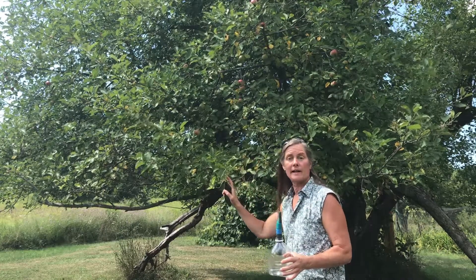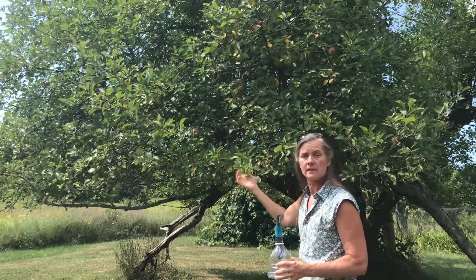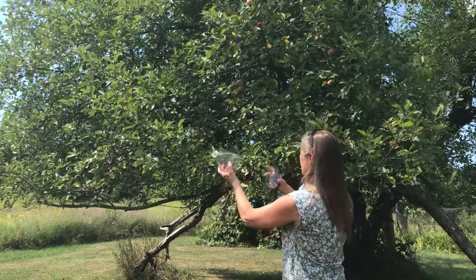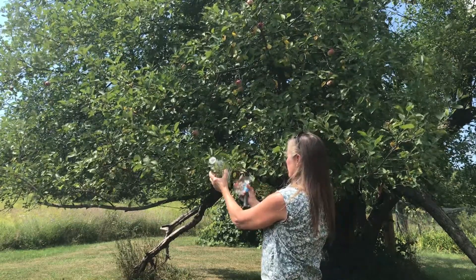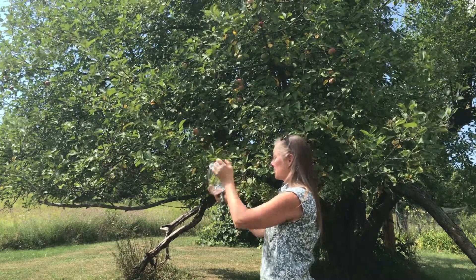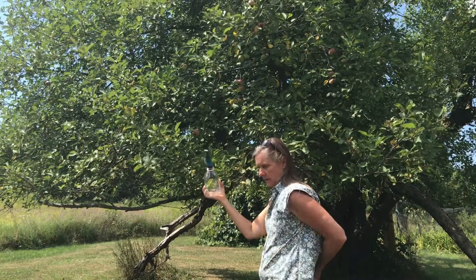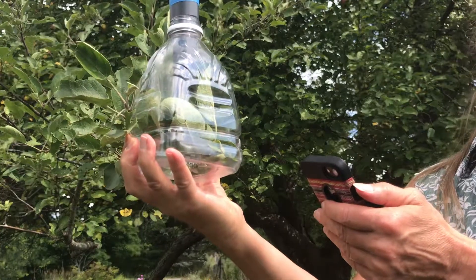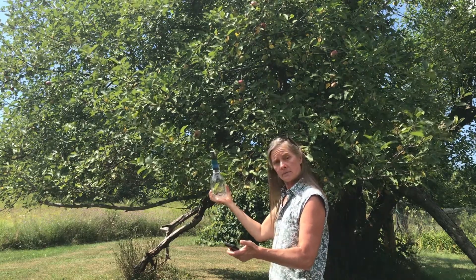Okay, so here we've got an apple tree, and you can see that it's got some fruit on it, so we know that this tree's photosynthesizing. It's growing that fruit, so let's set up our chamber and see if we can record some data from this apple tree. I'm going to put the leaves in the chamber, put the notch line up, make sure we're in the sun, get my sensor in there, and tell it to start collecting. We'll let this go for five minutes and we'll see how we do.